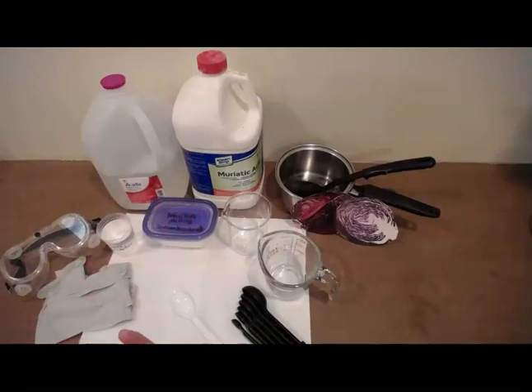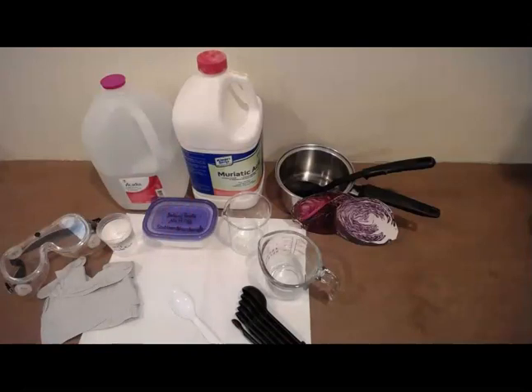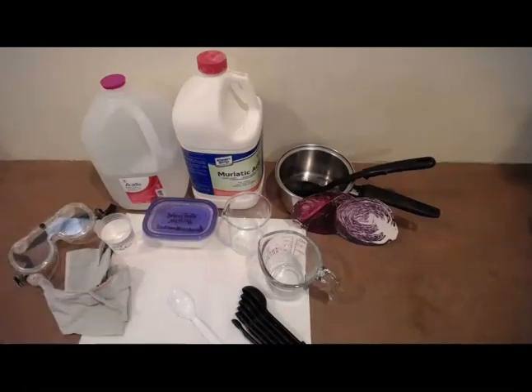And again, if you're going to do that, have an adult who knows what they're doing help you. Make sure you're wearing eye protection as well as gloves. And be aware that the fumes that come from the muriatic acid are very strong and can damage your respiratory tract. So you want to protect that and don't be breathing in those fumes. Always add the acid to the water and remember your safety gear because that can actually be very dangerous.